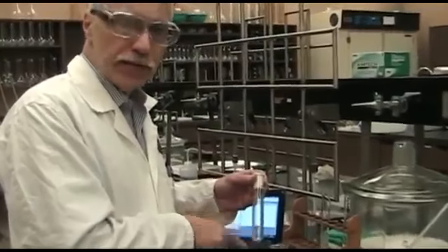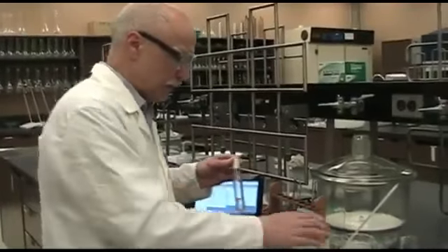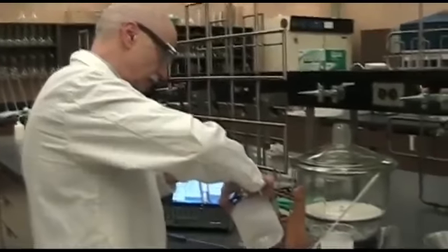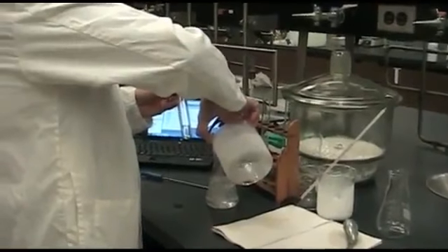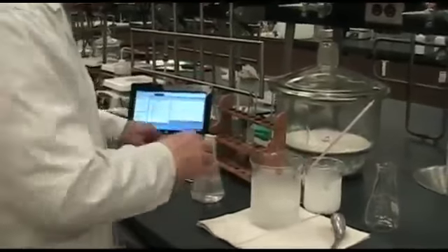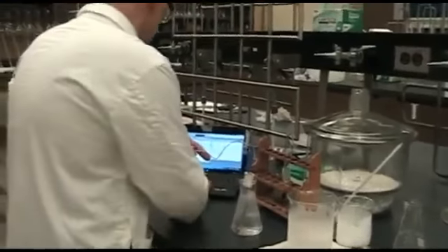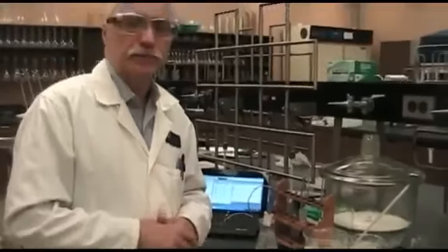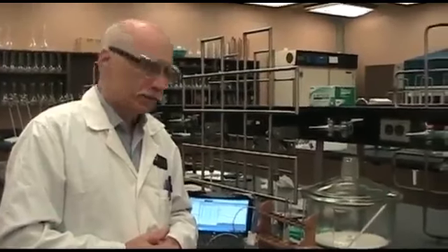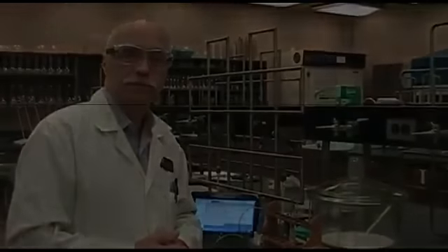Now we're going to do the same procedure with the calcium chloride to see if there's any change because of the calcium chloride formula. So again, we'll put our -40 degree ethanol into our Erlenmeyer flask and start recording the temperature. And it's going to be a while as well, like last time, so we'll cut back and forth as the experiment proceeds, and we'll fill you in on the important points.